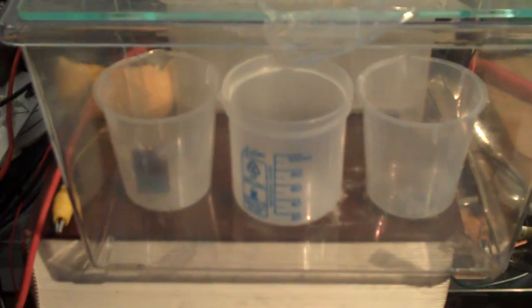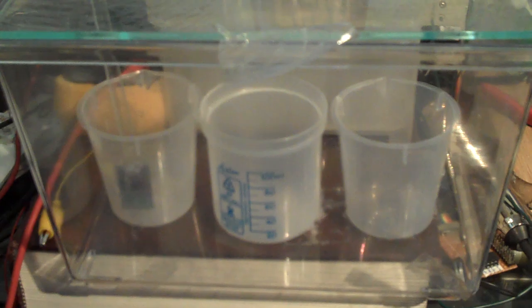Here's a box that you can make out of an old fish tank for doing your etching. You can cut a groove in the plastic lid and label it—here it's etch to rinse.